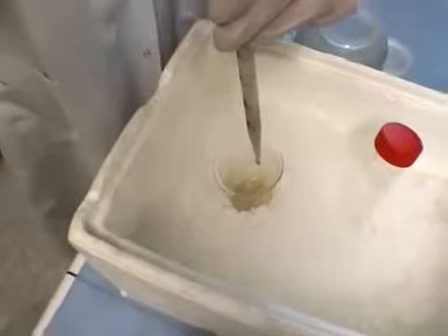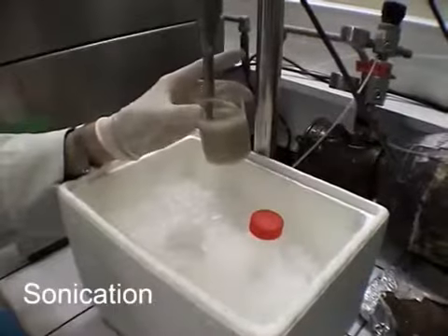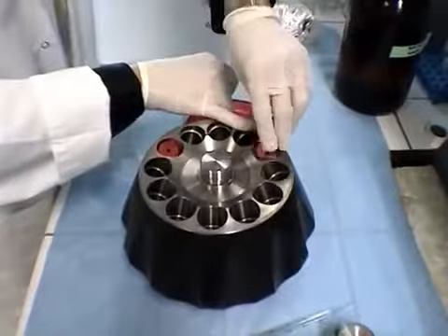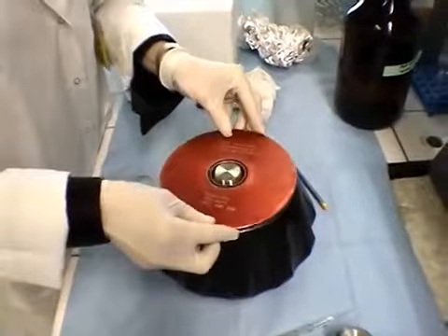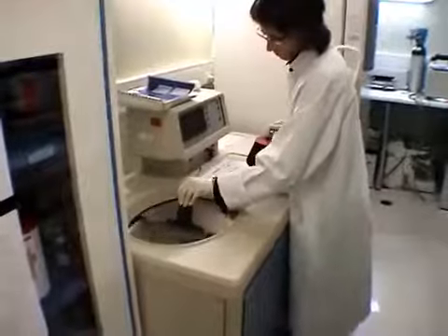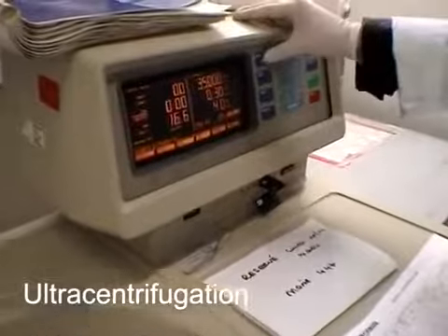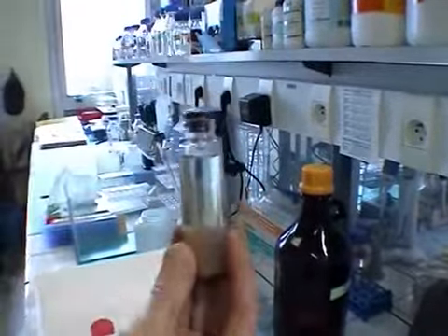This pellet of cells is resuspended in a cold, clean solution, and the cells are broken by applying ultrasonic pulses, thus releasing the molecules that they contained. Centrifugation at high speed pellets the cellular debris, and the liquid, or supernatant, containing the molecular contents of the cells is recovered for treatment by chromatography.